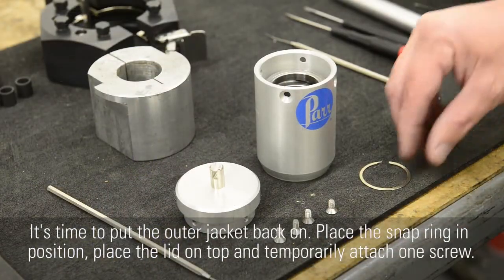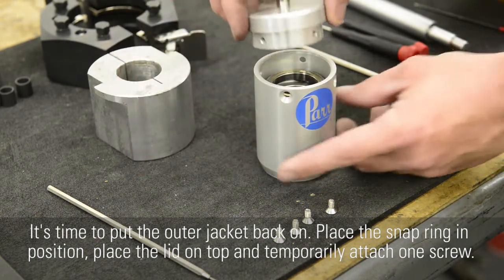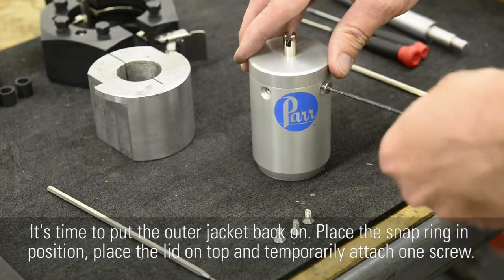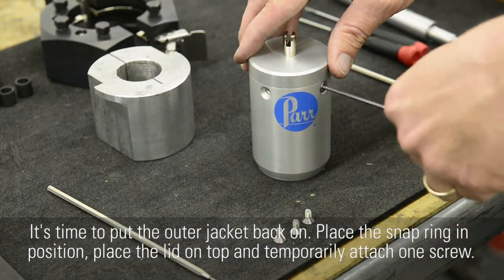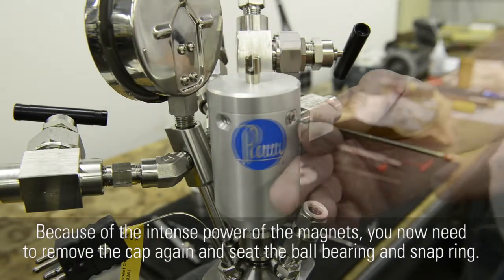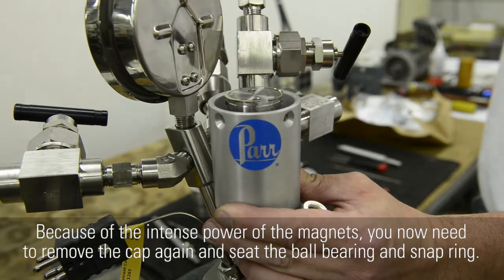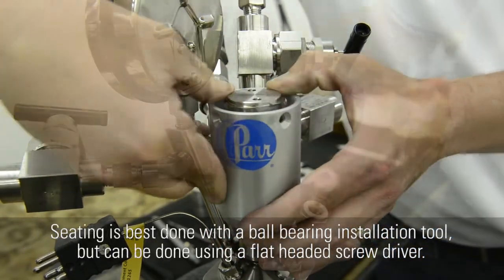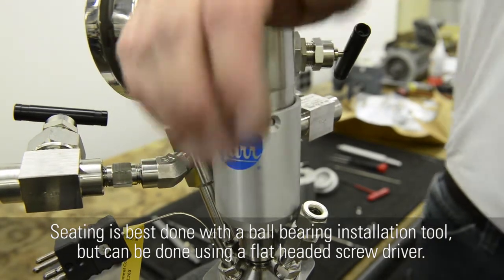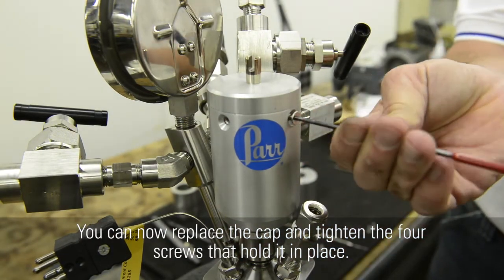It's time to put the outer jacket back on. Place the snap ring in position, place the lid on top, and temporarily attach one screw. Place the jacket over the mag drive housing. Because of the intense power of the magnets, you now need to remove the cap again and seat the ball bearing and snap ring. Seating is best done with a ball bearing installation tool, but can be done using a flat-headed screwdriver. You can now replace the cap and tighten the 4 screws that hold it in place.